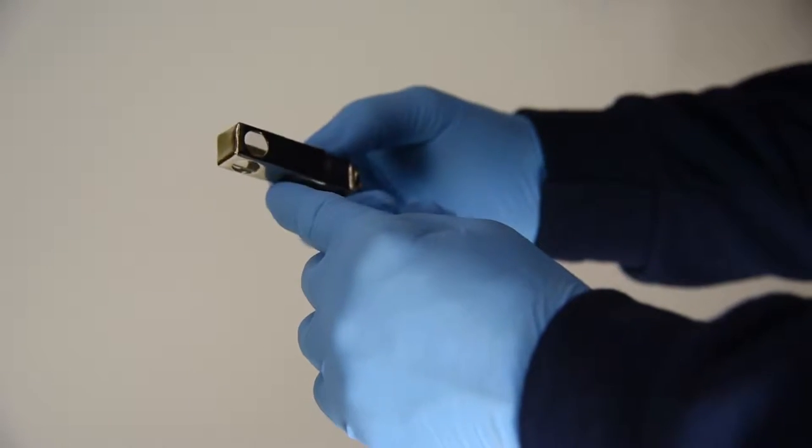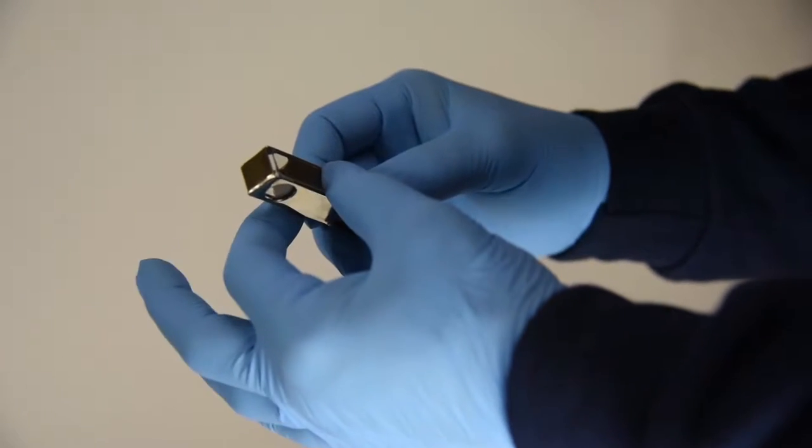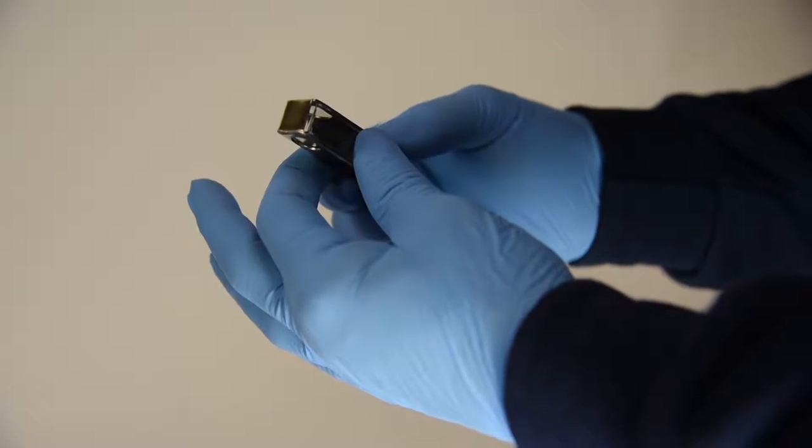If you're worried about it falling out, I recommend you put a little piece of mylar or Kapton tape around the perimeter and that'll hold it in case it would slide out once it got cold.